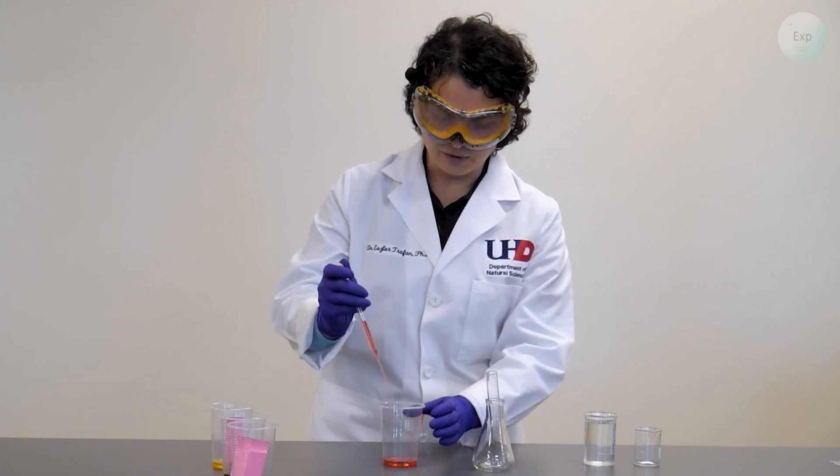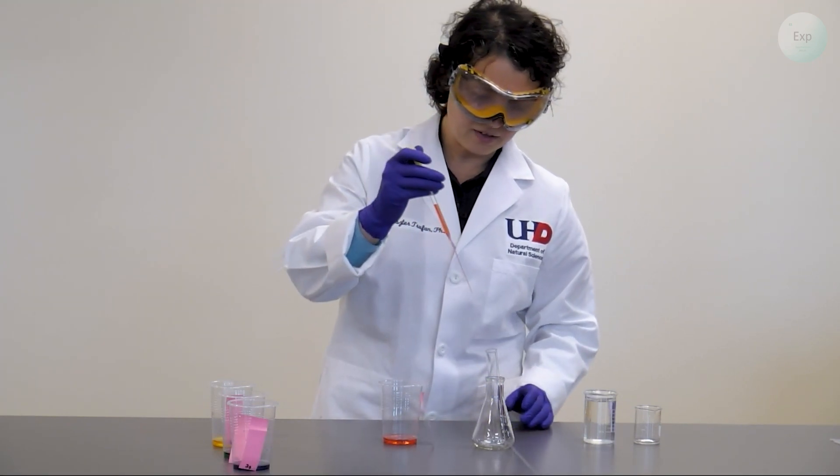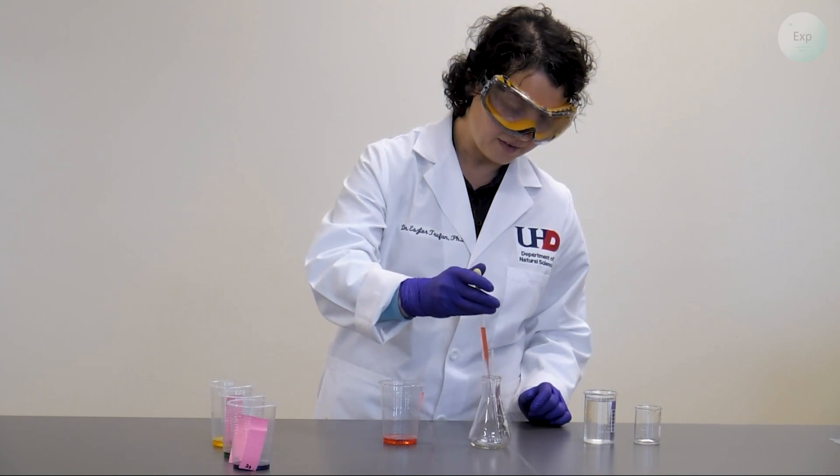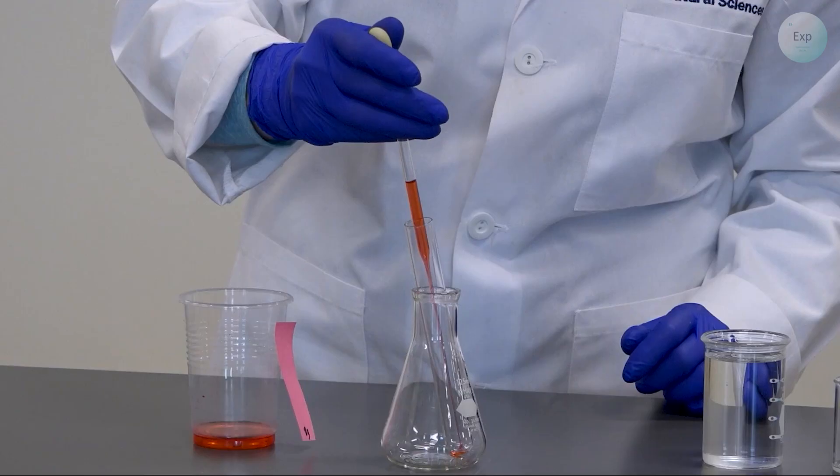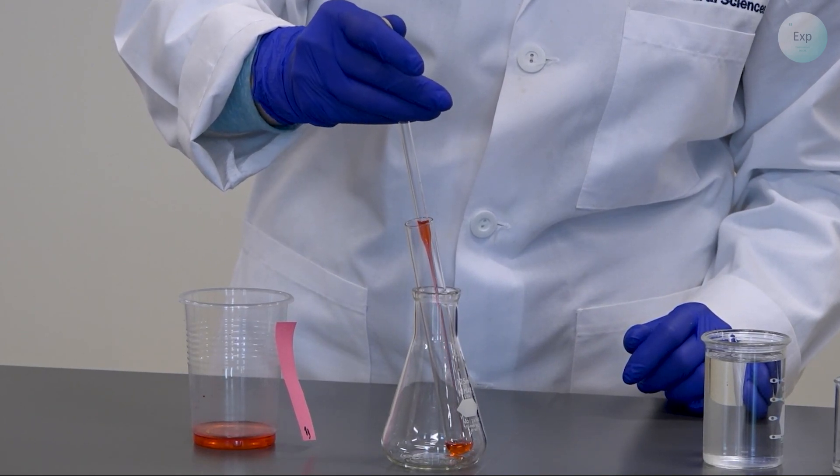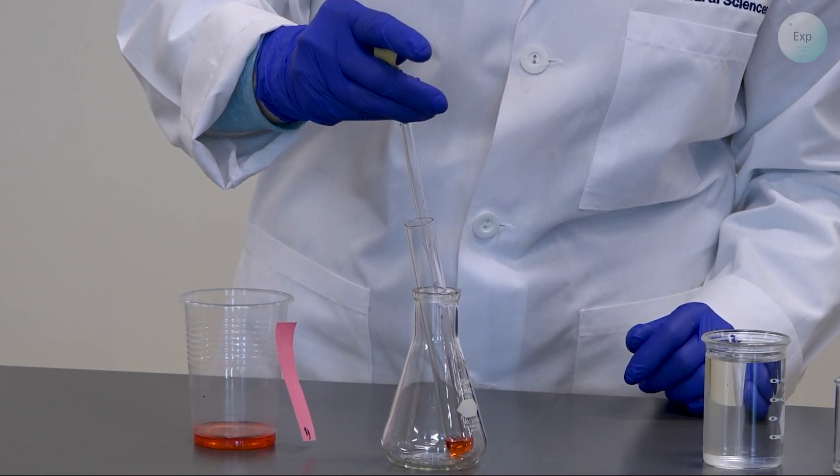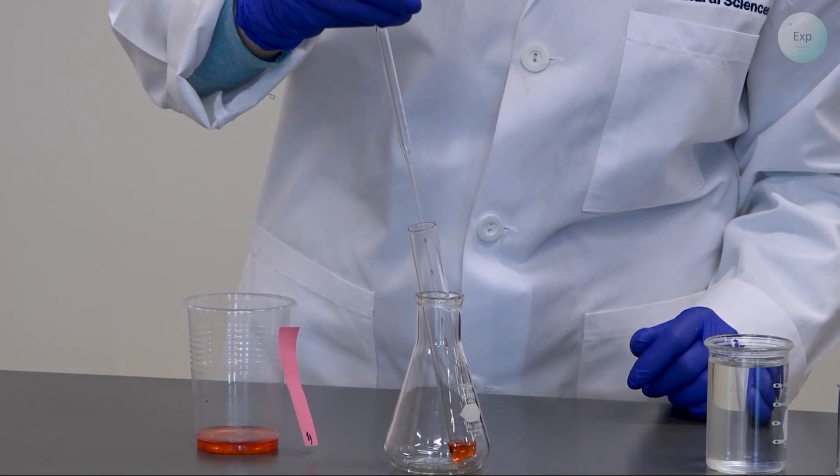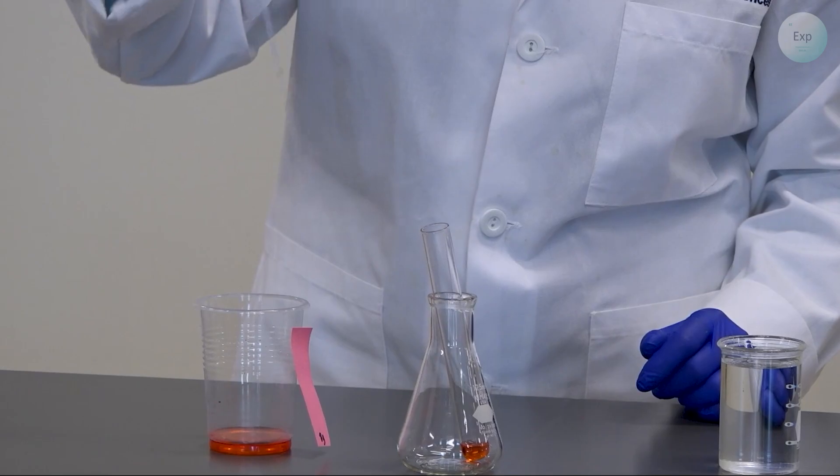Once it is rather full I will gently transfer the solution into the bottom of the test tube that is inside the Erlenmeyer and release it without touching the walls of the test tube. And when all the solution is released I will slowly pull it up without touching the walls of the test tube.